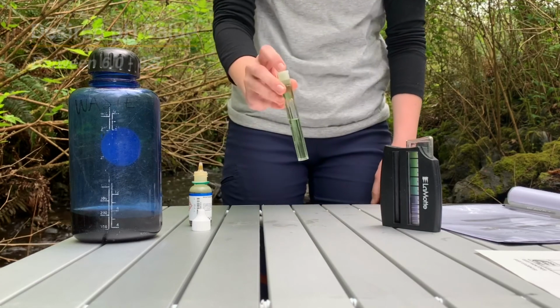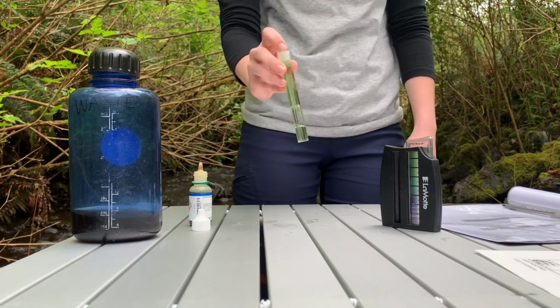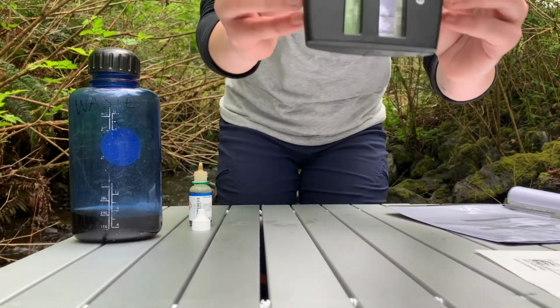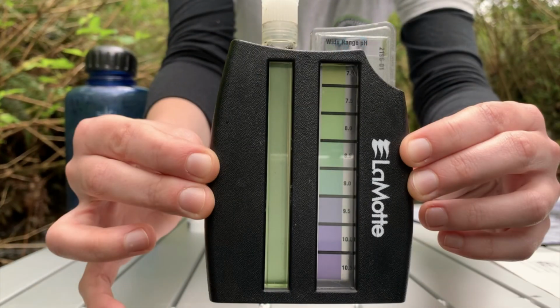Natural waters, like the streams we monitor here, are influenced by the pH of surrounding soils coming in contact with the water, meaning that it will be influenced by things like construction and agricultural practices. Here, we've added some wide-range indicator to help us visually determine the level of pH in this stream. Look at the color of our sample and help us decide which pH value on the Octaslide viewer matches.